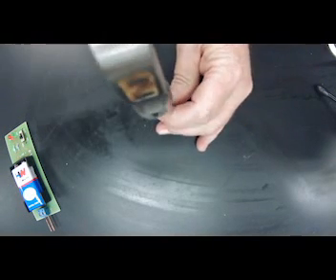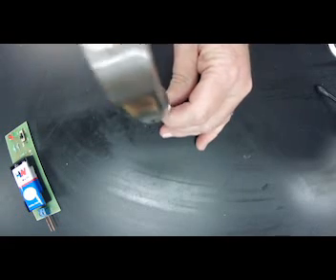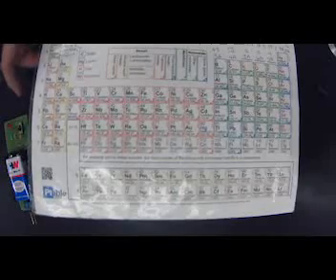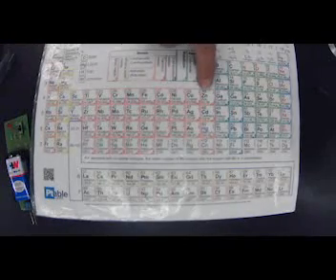Is it malleable or is it brittle? And again, not brittle, it doesn't even break. That's why we can have it in a flat sheet. And the last one is conductivity. And it does conduct electricity, for sure. And so, of course, zinc, as soon as I find it on here, is here, number 30. It is a transition metal, so it should have all those properties of a metal.